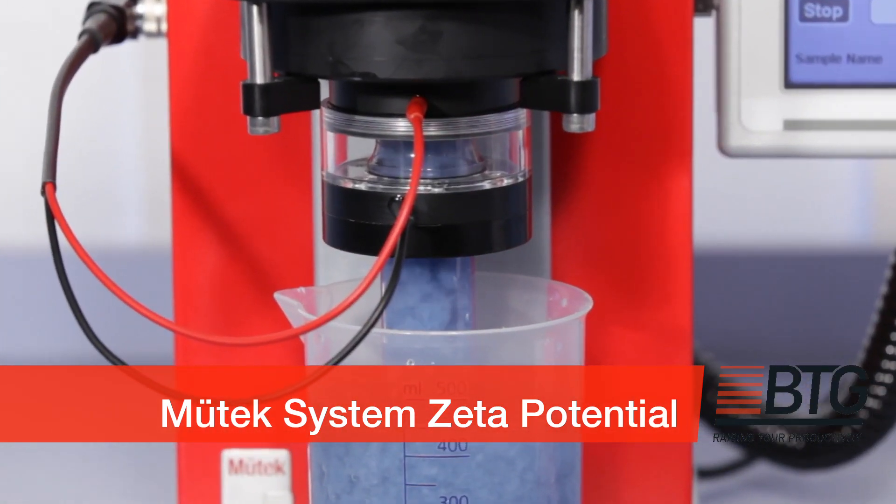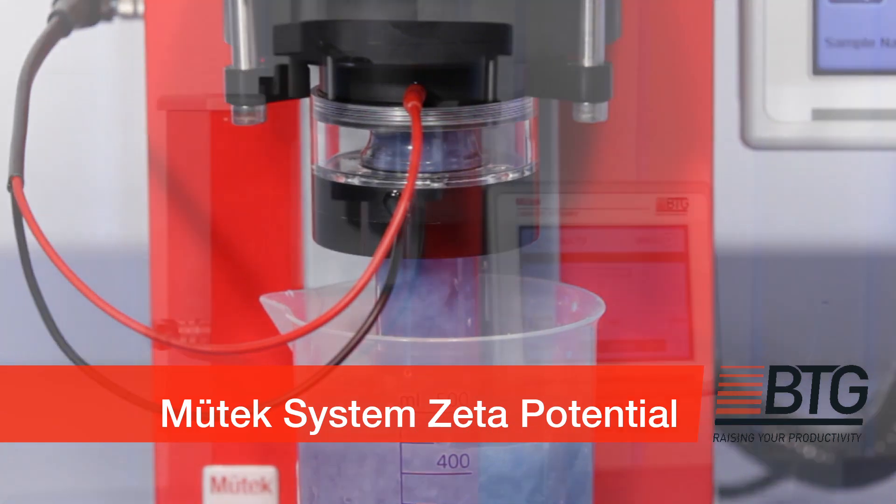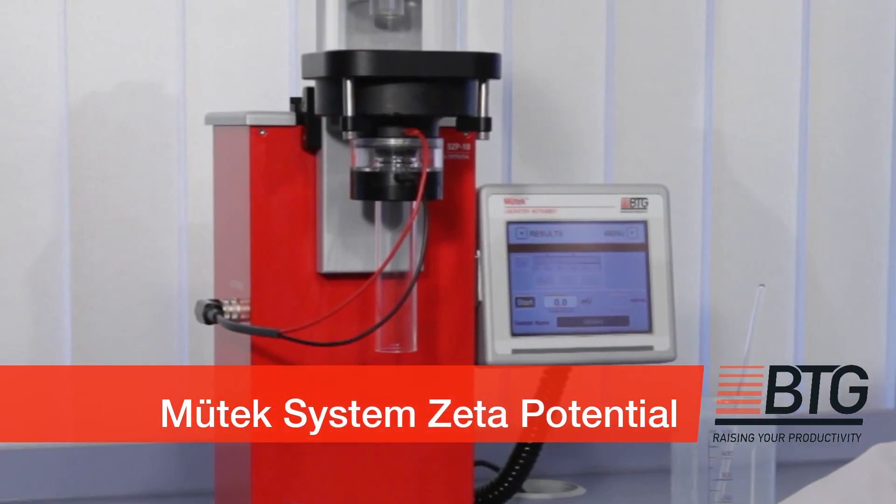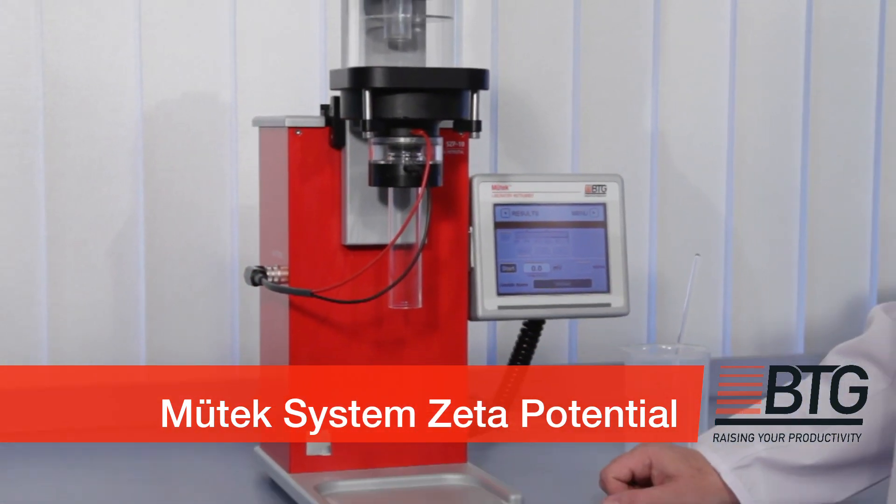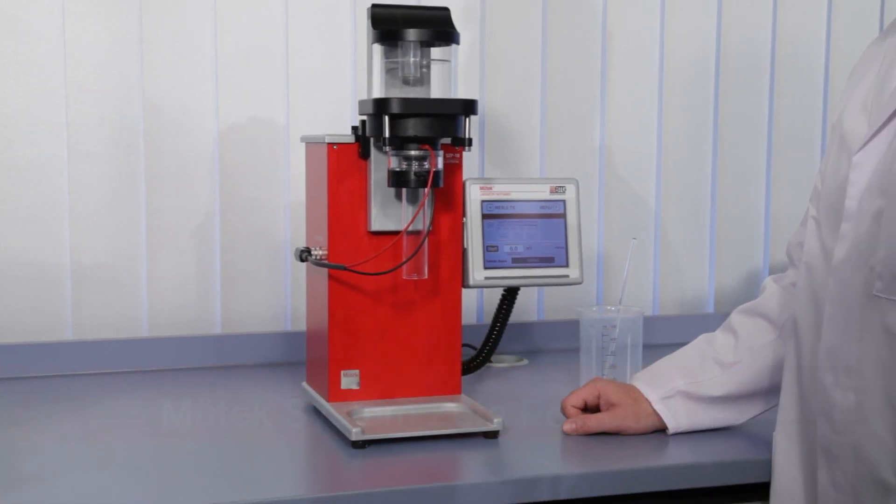The device generates and detects the streaming potential of a sample by measuring its conductivity and calculating the zeta potential from these measured values.